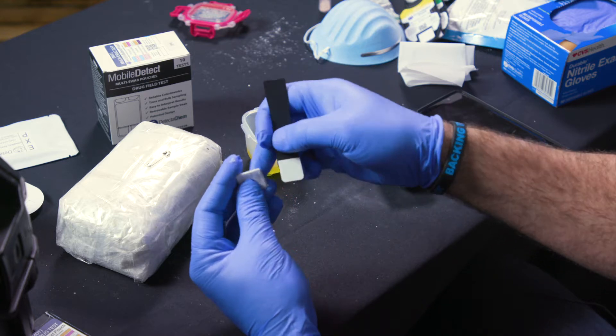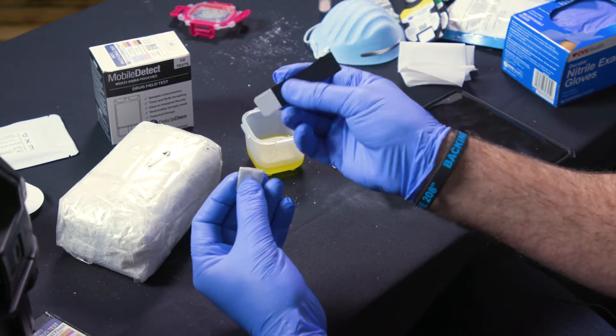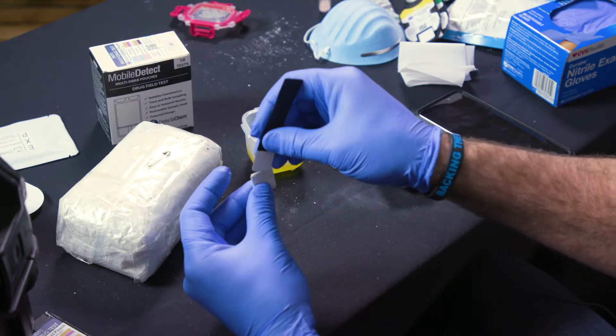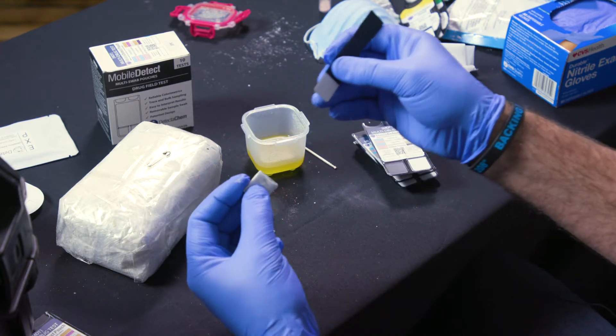And again inserting this right down into the folds. All of that material is within the folds and these actually fit quite well right into there. So you'll definitely get enough sampling material on there inserting it into the folds of the wax paper.